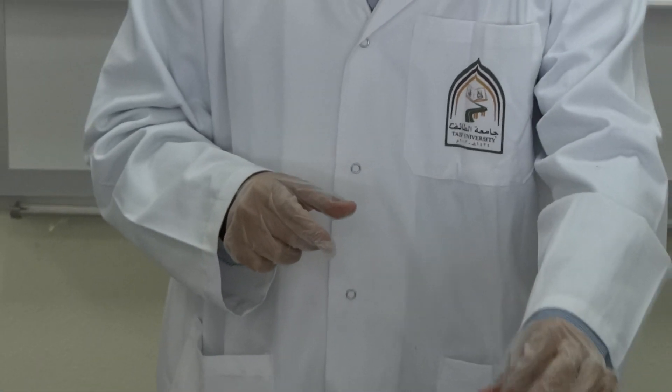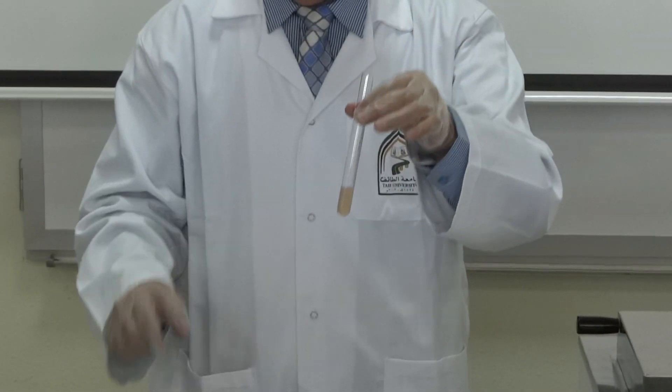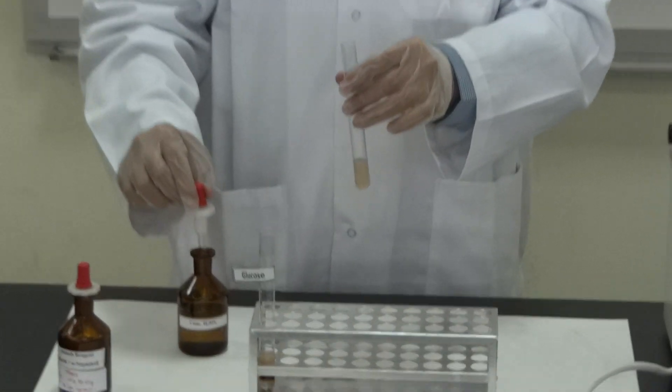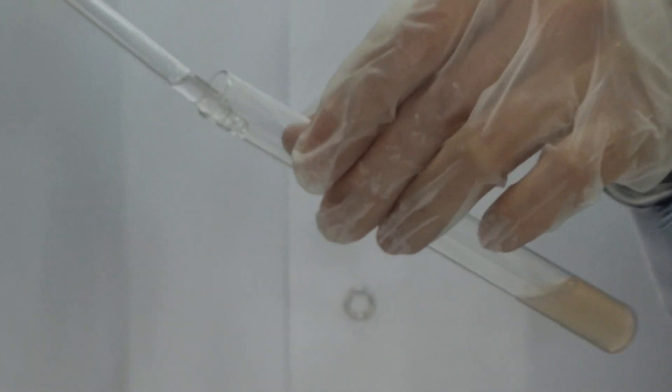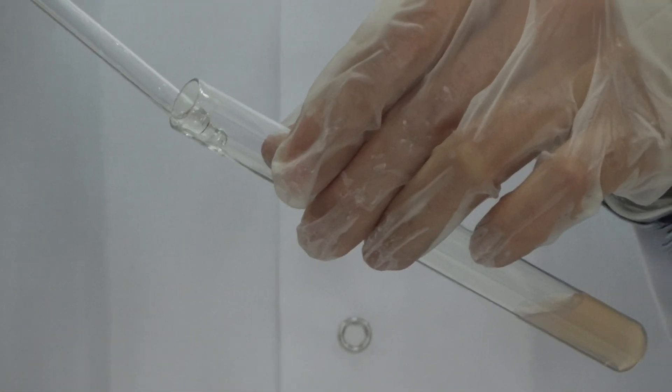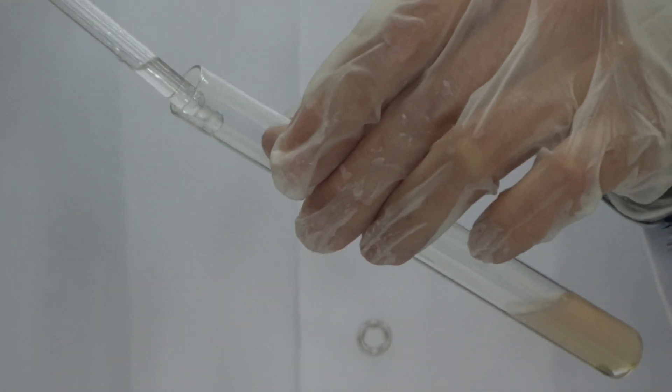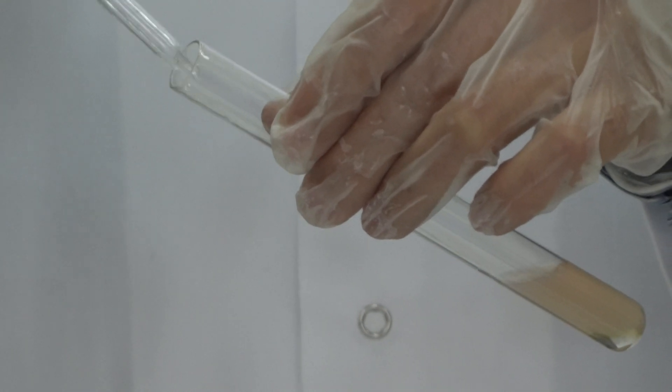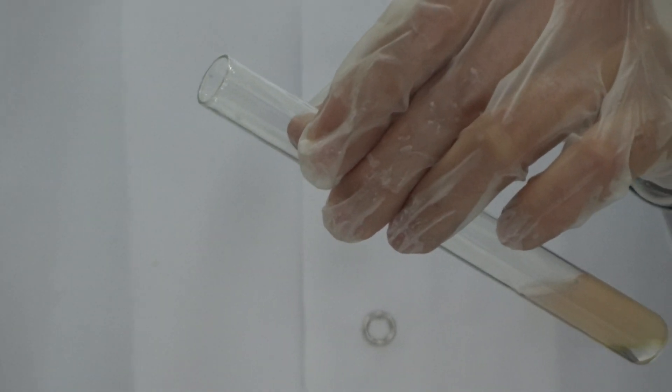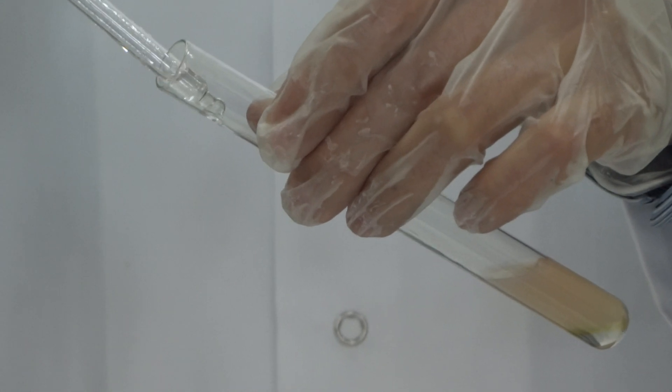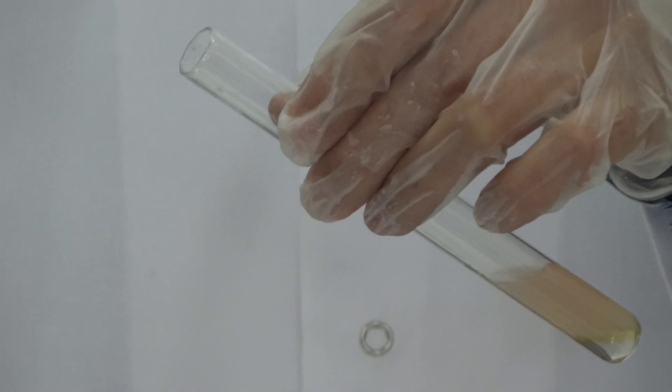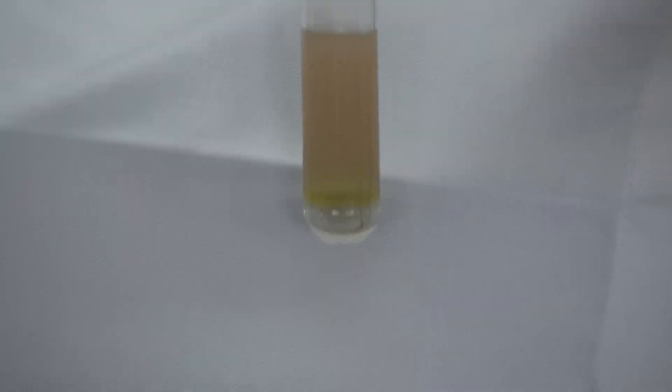So, what can happen? We did the same thing with some things that are not carbohydrate. Let's do the same thing. Bend the tube, slowly add at the side. Is it enough? What can I see? No violet ring. This is a negative result.